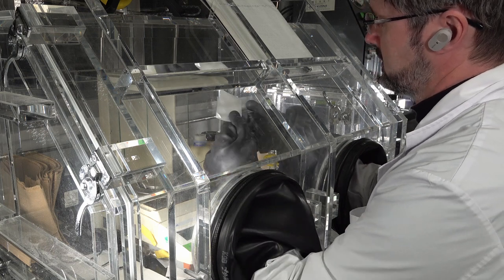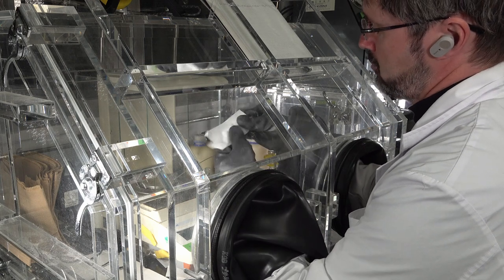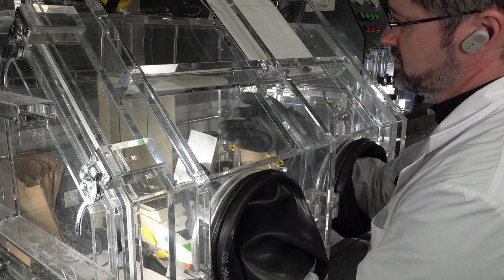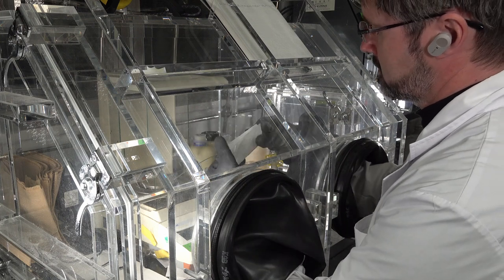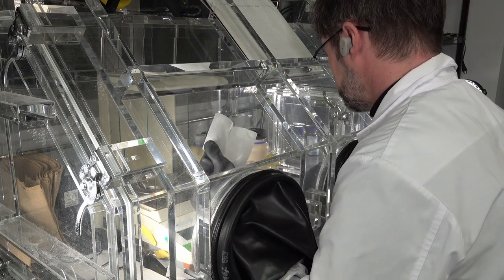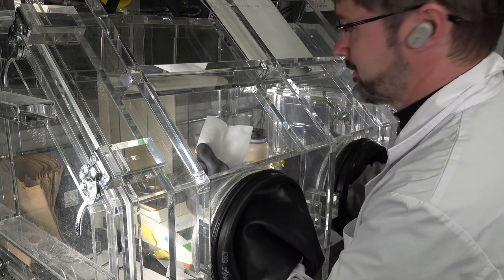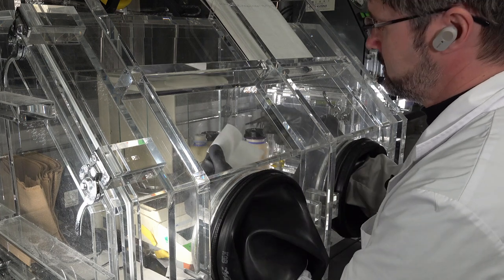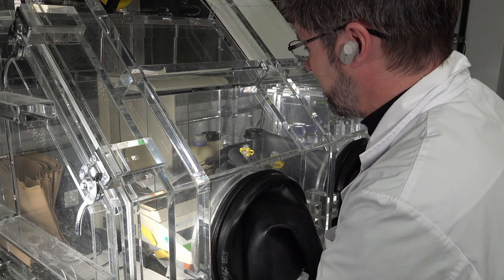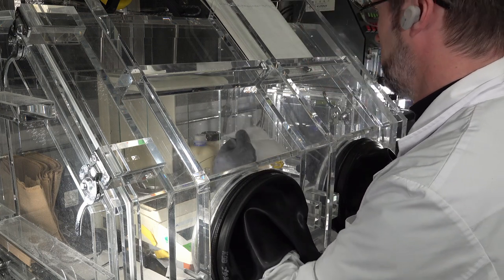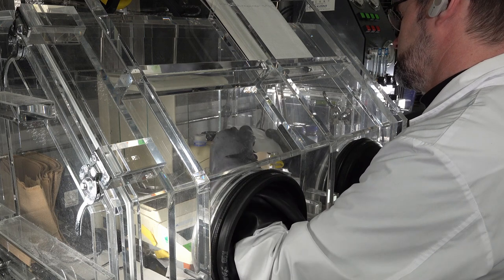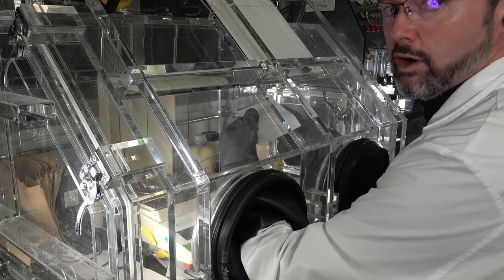Everything's hard when you've got glove box gloves on because these gloves are so thick you can hardly feel anything. Plus they're too long, so I don't know where the end of my fingers are. So it's useful to use tweezers. And it's so hard not to accidentally tip over a flask of solution or solvent as well because the space is so cramped and you've got so little room for maneuver in these places. It's actually quite stressful.